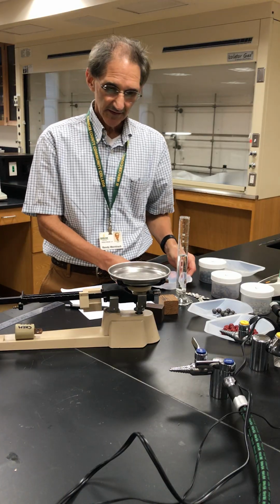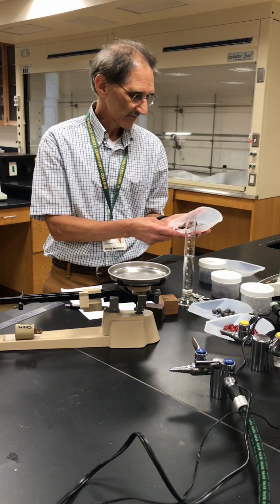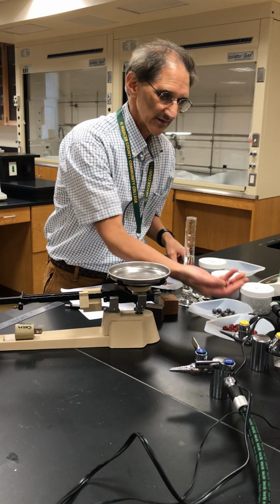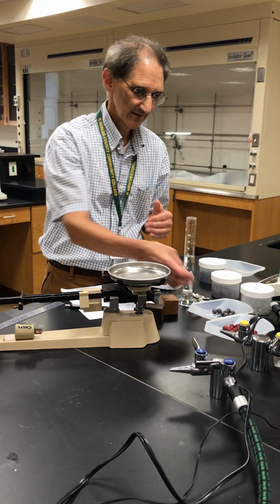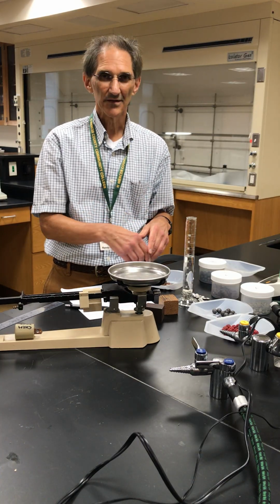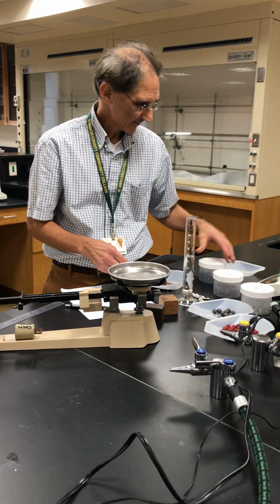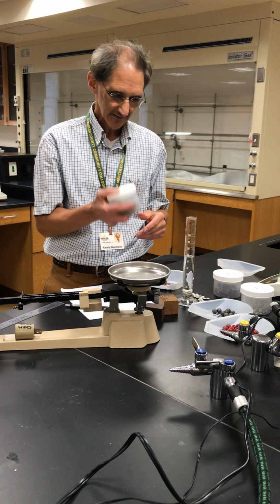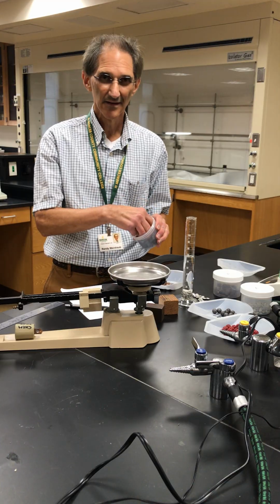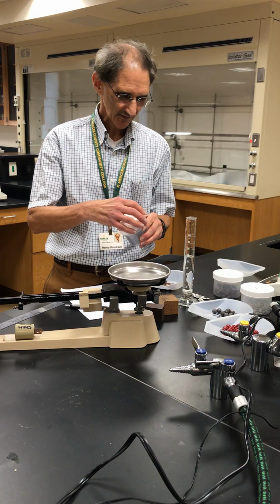I also recorded, which I did already, I did this similar procedure for the copper and for these cool glass marbles, to get the density of those. I weighed some of them, put them into water, look for the displacement. I did the same for copper, and this really, really heavy stuff, and this is lead, Pb, lead. Okay, really interesting materials.